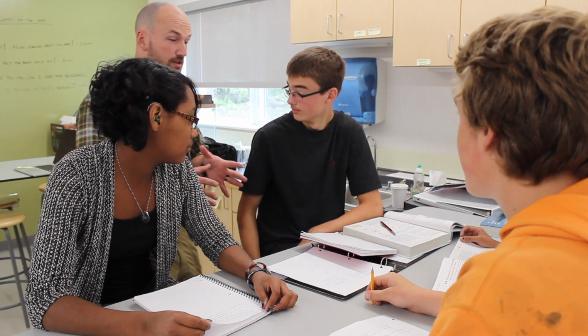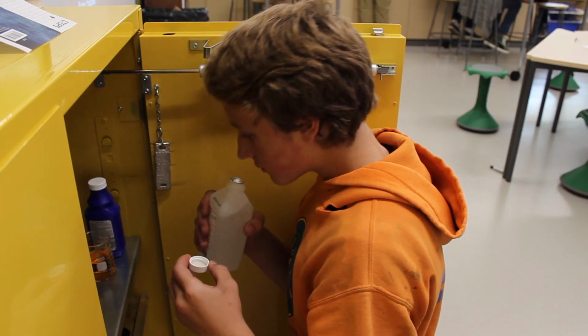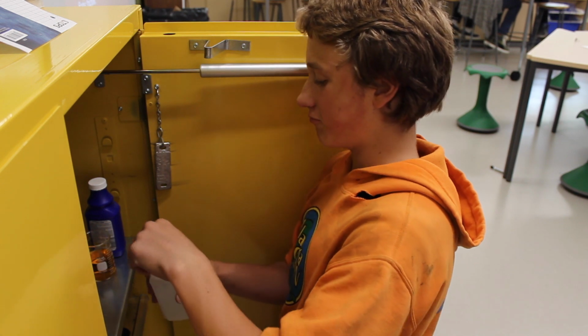Hey guys, we don't have much time. We need to quit fooling around. Callum, could you go grab me some hydrochloric acid out of the counter, please? Yes. Whoa. No.